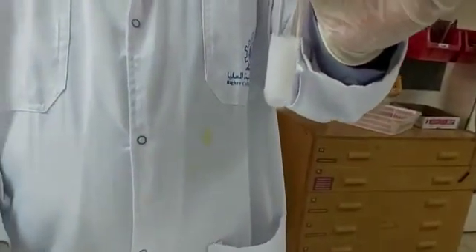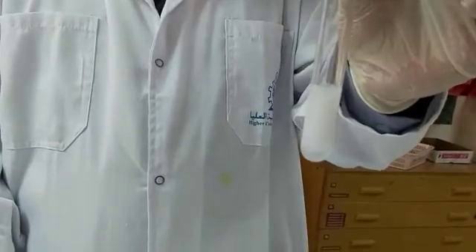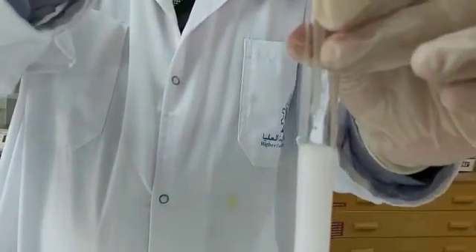This white precipitate should not dissolve in excess of ammonium dihydrogen phosphate. I will be adding an excess of ammonium dihydrogen phosphate, and you can easily notice that the precipitate is not dissolving. This is the confirmatory test that the cation is magnesium.